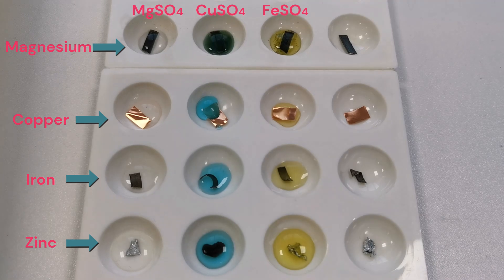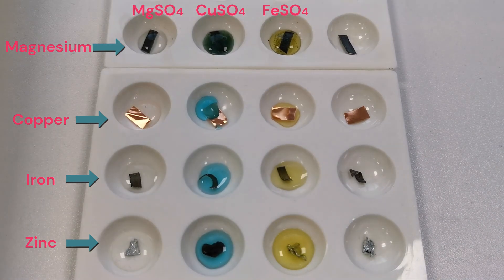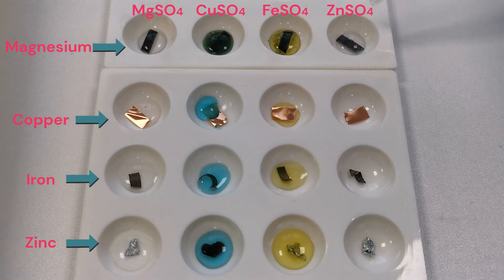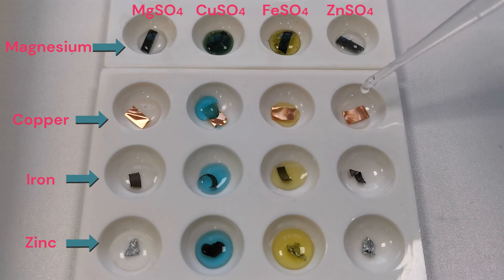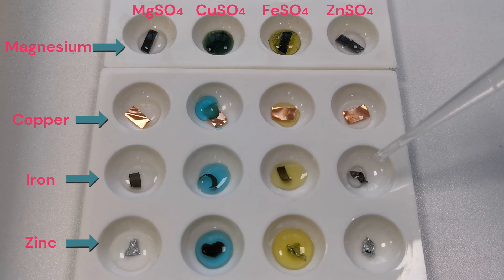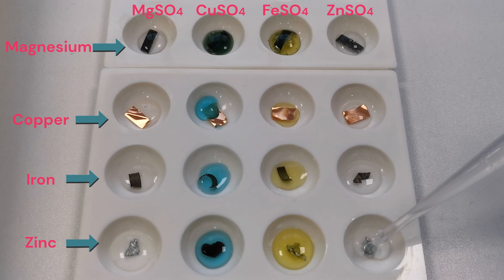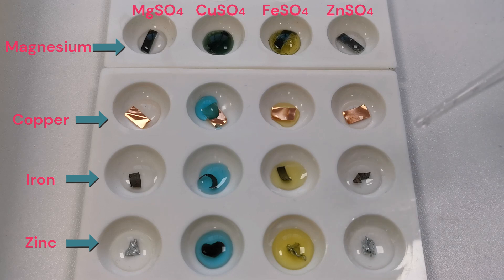The last solution we're going to add is zinc sulfate. Straight away we can see a reaction happening with the magnesium. No reaction with the copper, no reaction with the iron, and no reaction with the zinc.